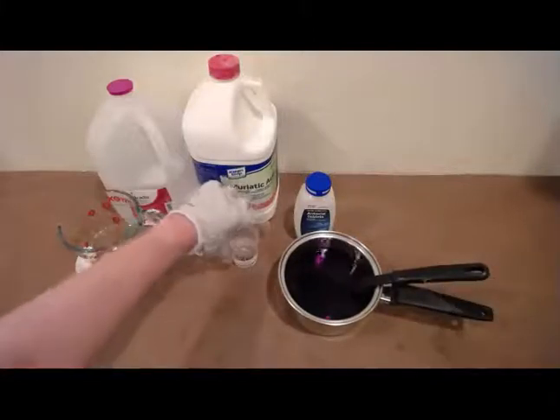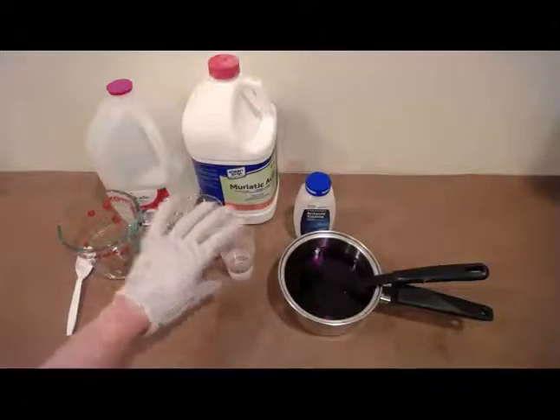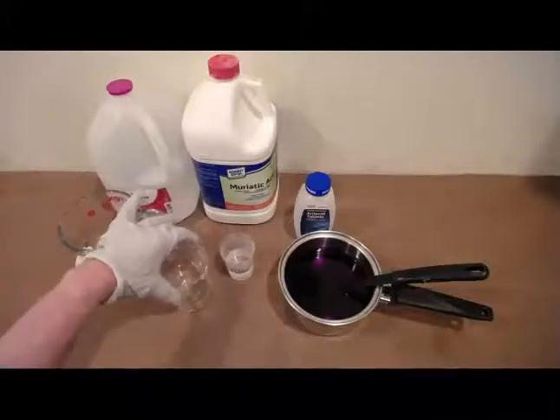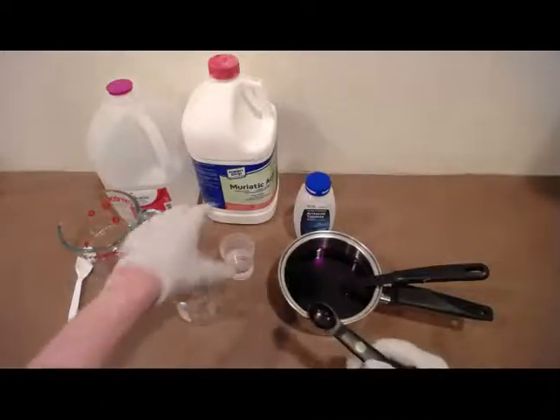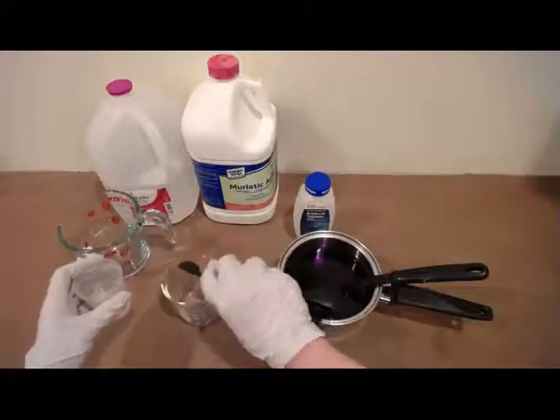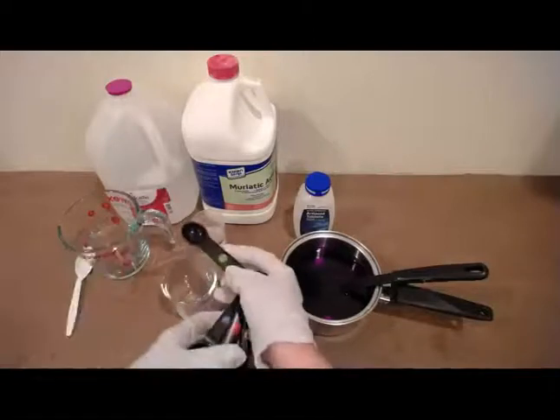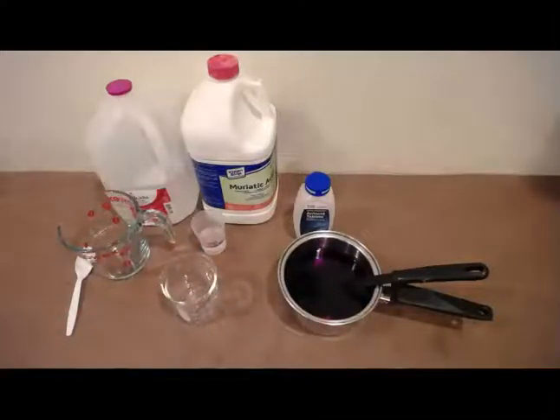And here I have made that solution I spoke of with the muriatic acid and water, again taking great care so that I did not burn my skin or my respiratory tract or get it in my eyes or anything like that. Okay, so we're going to go ahead and measure the 1 teaspoon of that into the beaker. And I'm going to put the teaspoon directly into the sink so I don't contaminate my countertop there with an acid.